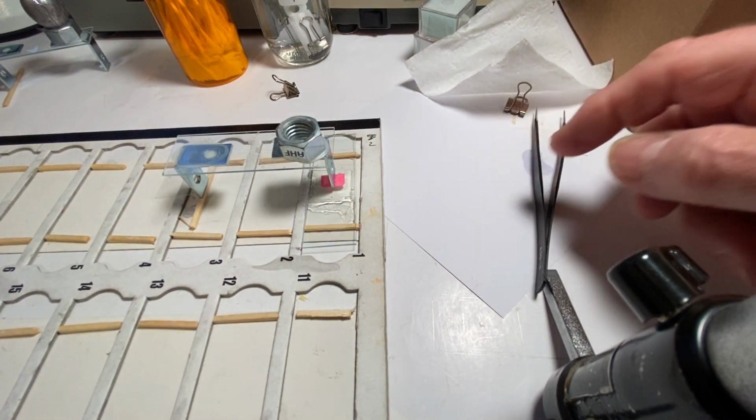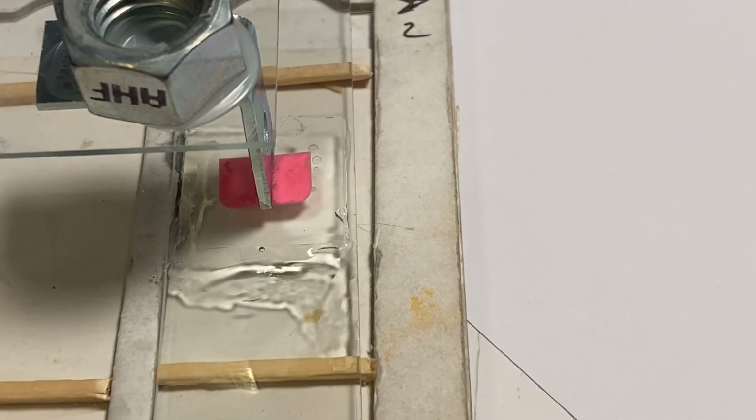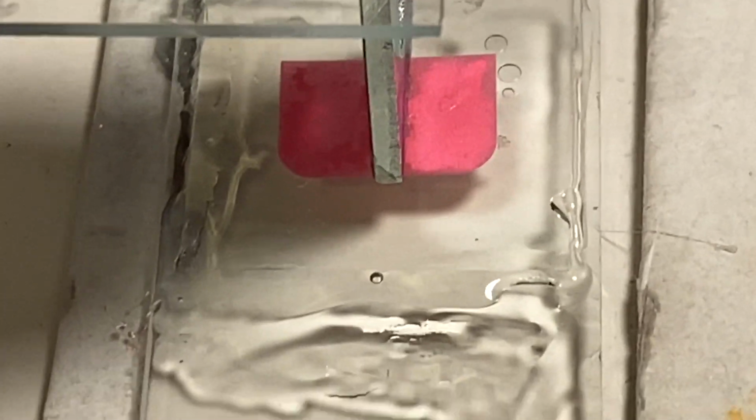There we go. And I can see just myself. I don't know if you're going to be able to see it with the video, but it's kind of oozing out just a little bit. Let me see. Can you see it oozing out? If I changed it, let me change it, put a heavier weight on there. I'll put the heavier weight. You might be able to see it oozing out. Hang on a minute. There we go. Yeah. See how it's squeezing out? Then we would get ourselves a Q-tip and we would just clean it very gently.